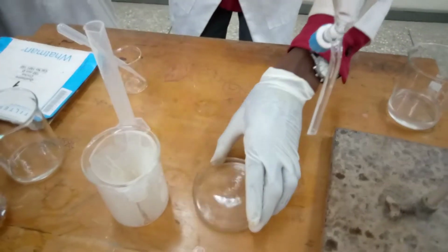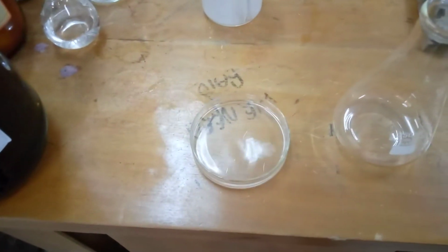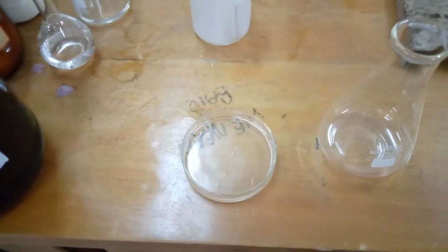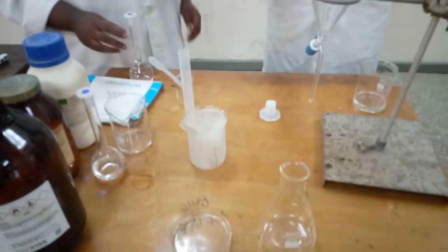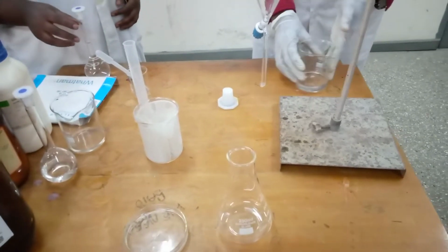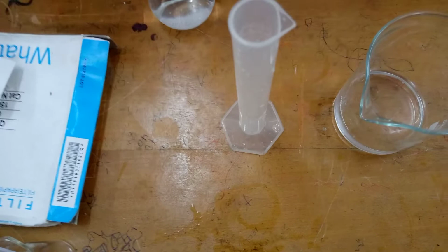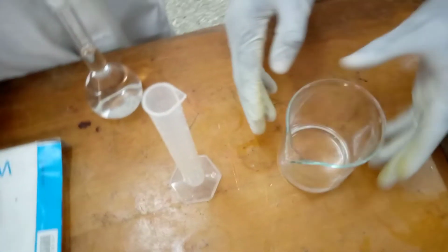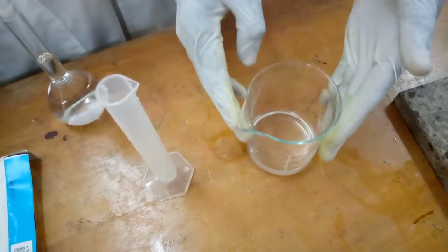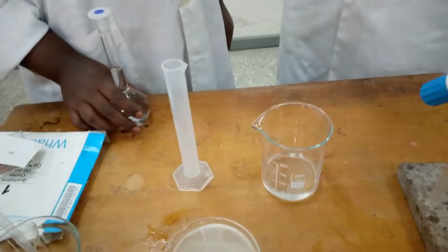So it means the organic layer containing the naphthalene we just leave it so that the ether will evaporate, leaving our organic layer. So we'll now move forward to the next step. We're now going to deal with the aqueous layer. And in the aqueous layer, you can remember that we measured 20 ml of sodium hydroxide, and we measured another 20 ml of sodium hydroxide in doing the extraction.